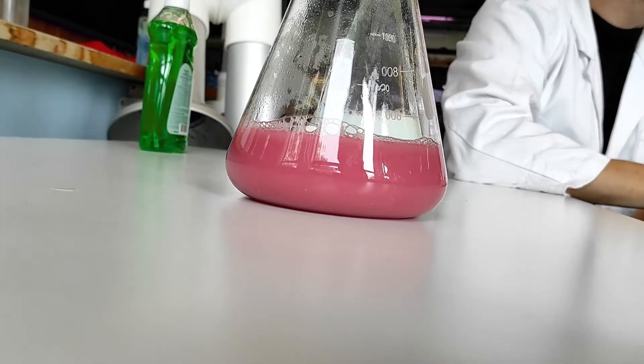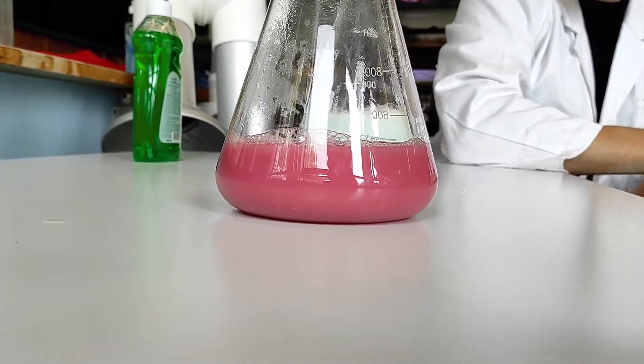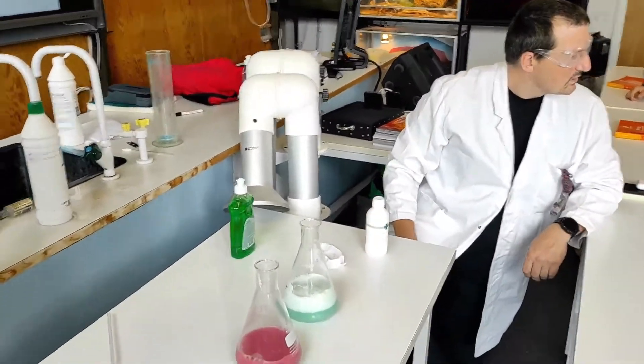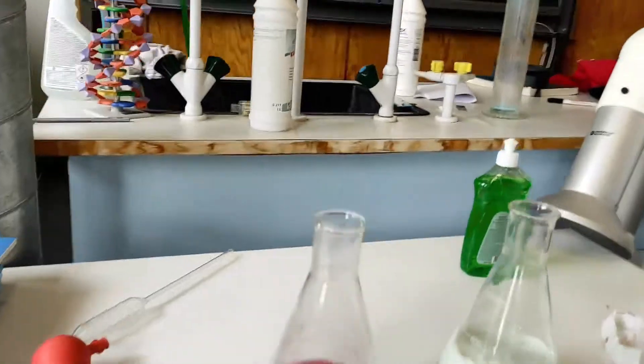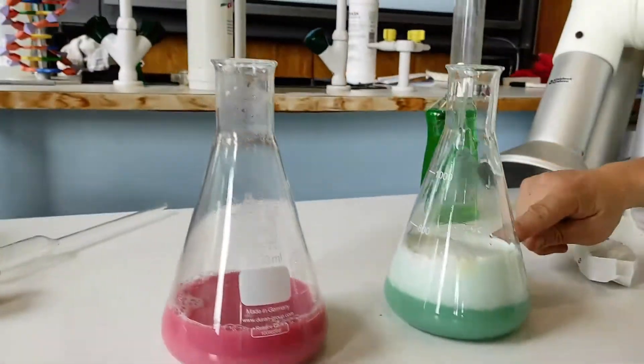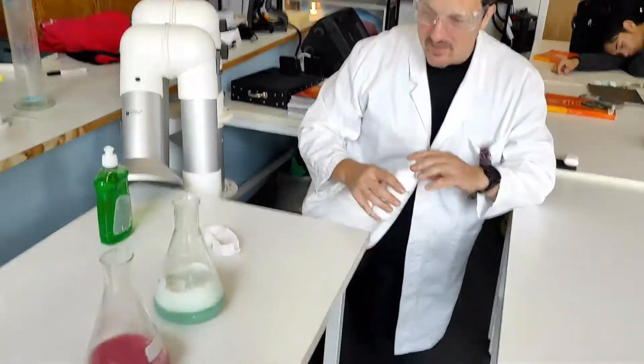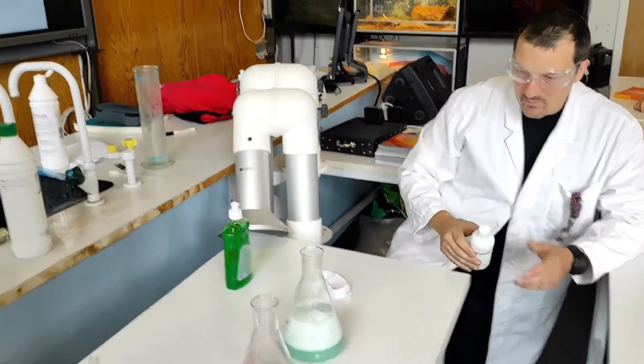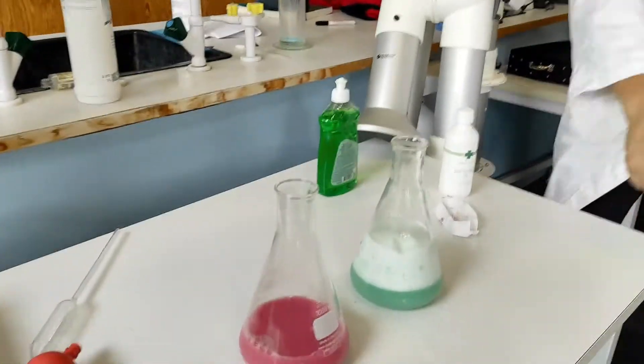Hmm, weird. It looks to me like nothing's happening. Here the yeast is happily hammering away at hydrogen peroxide. Nothing happening here.